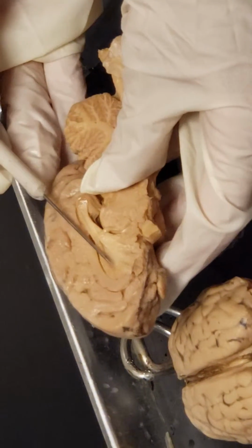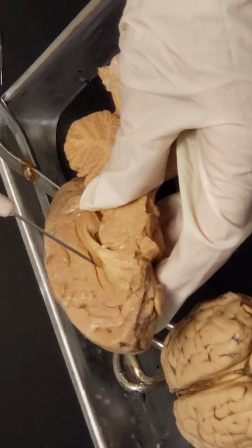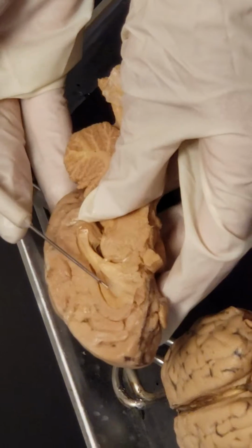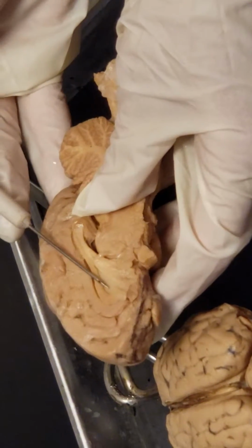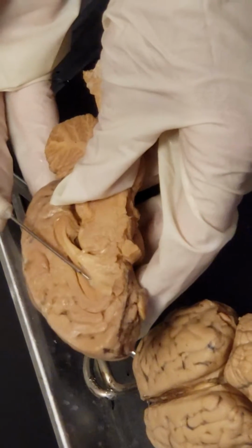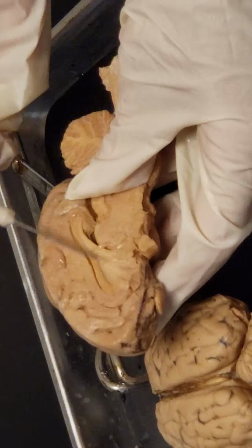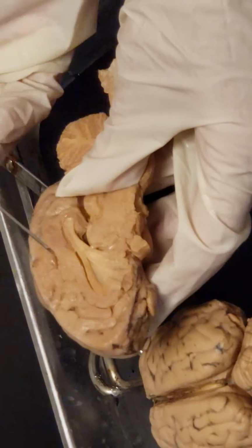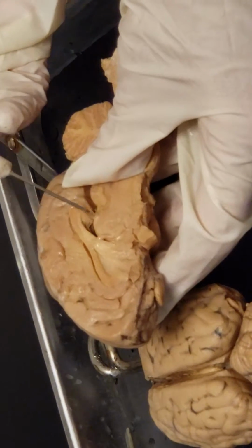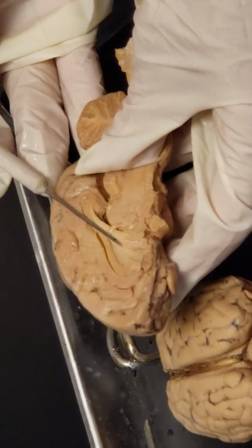And then just below that, remember, to the inside, if I were to stick my pin through here, I'd hit the lateral ventricle, right, where we've got that cerebrospinal fluid, and this is the window over it. So this is the septum lucidum or septum pellucidum right here, and it's a really thin layer that's going to separate those 2 lateral ventricles. And then underneath that, we have another commissure, which means bridge between the 2 hemispheres, and that's the fornix.